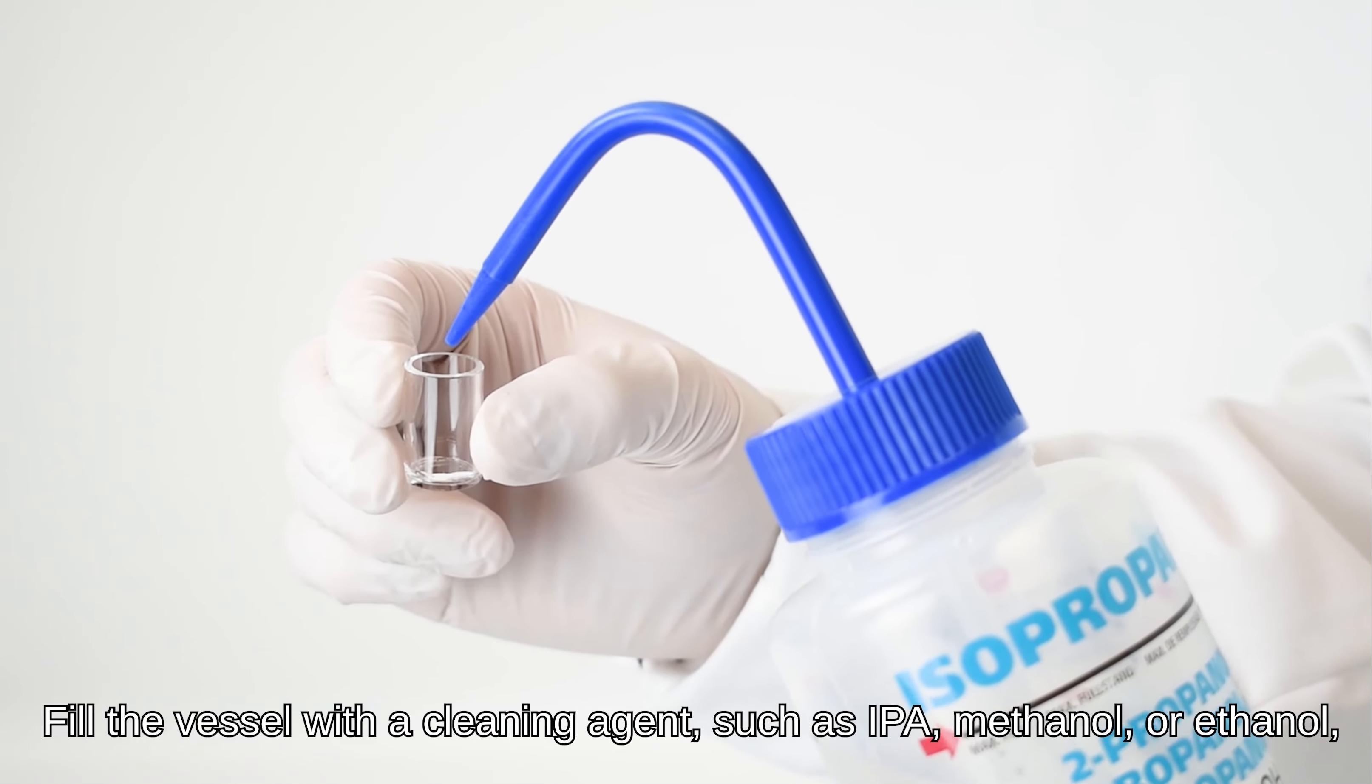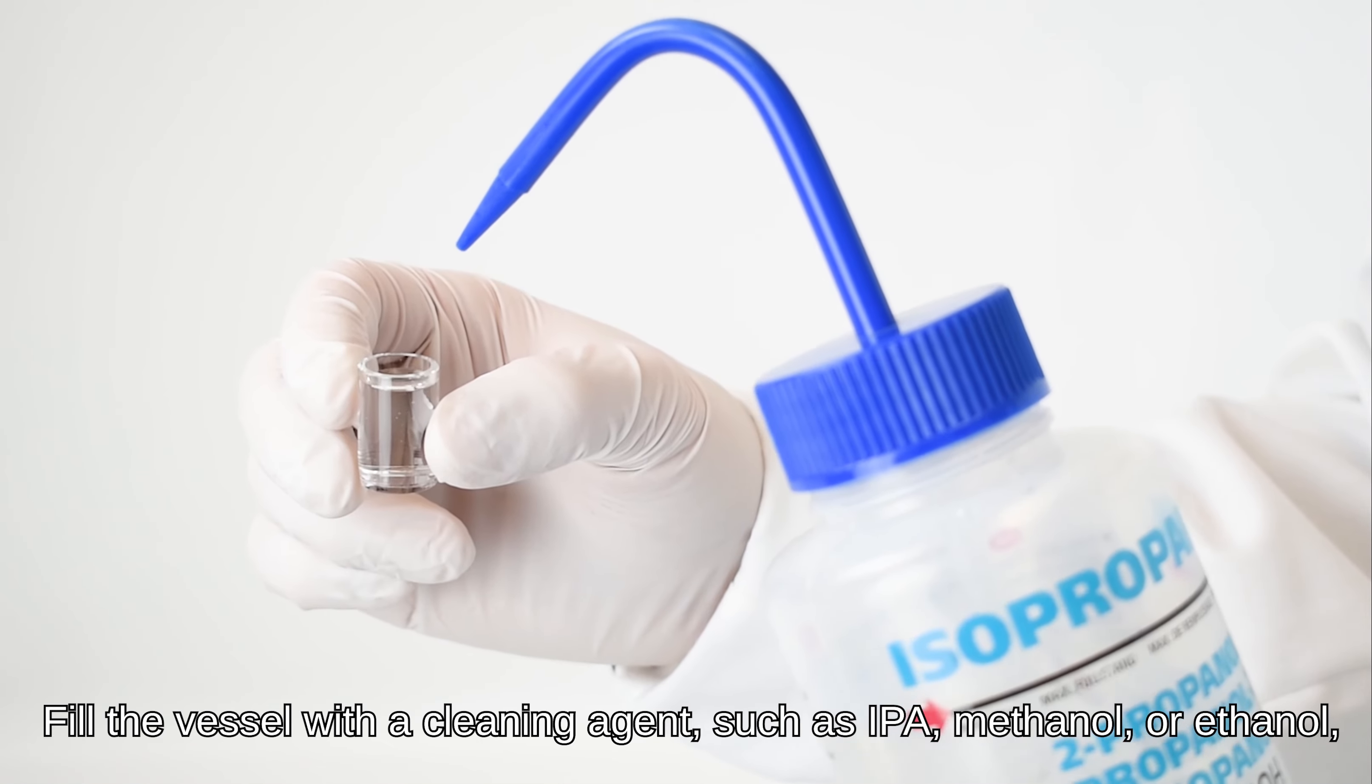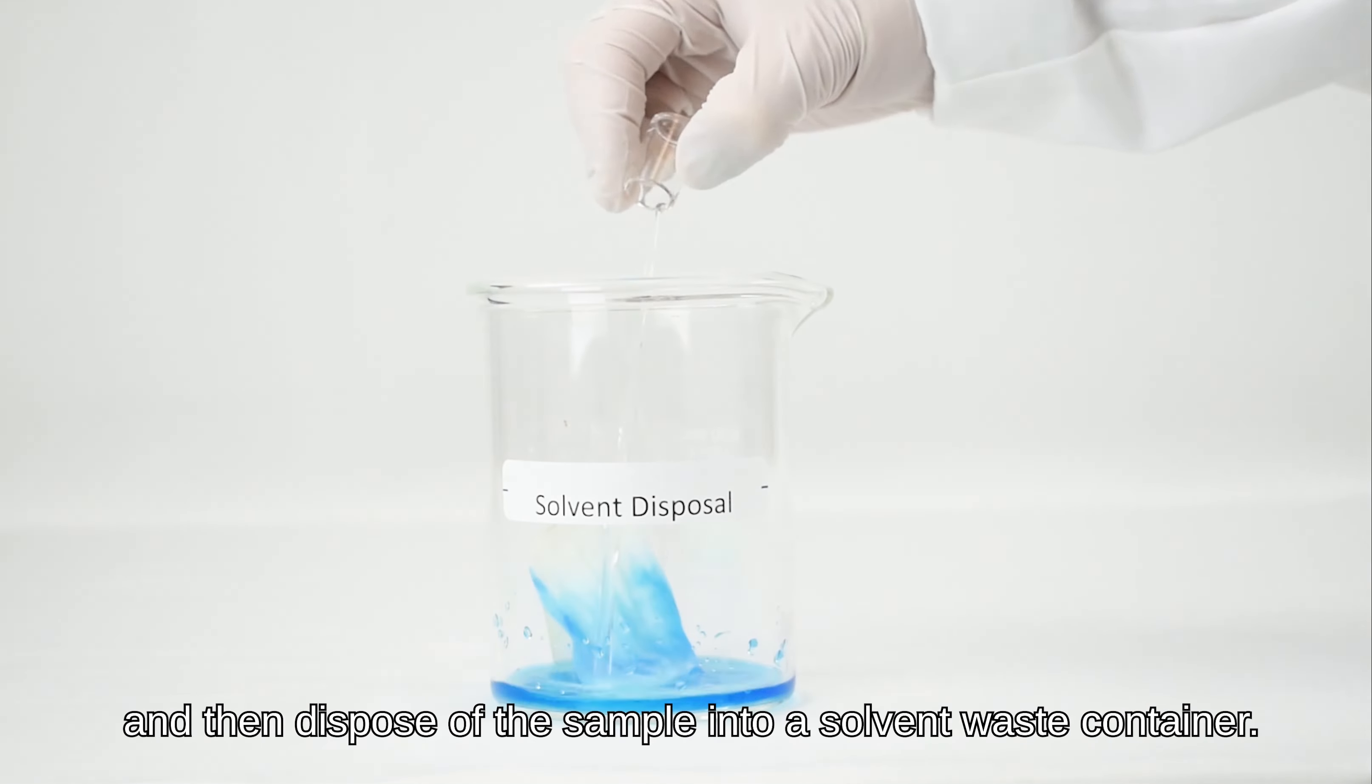Fill the vessel with a cleaning agent such as IPA, methanol, or ethanol and then dispose of the sample into a solvent waste container.